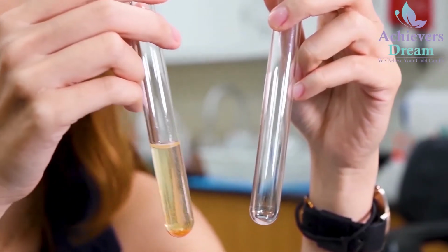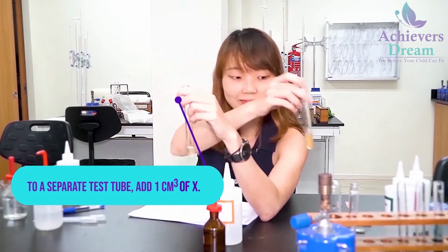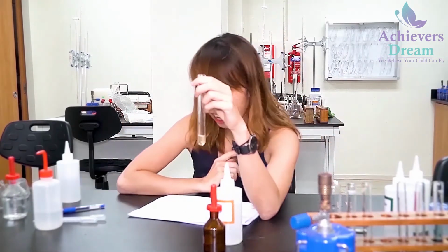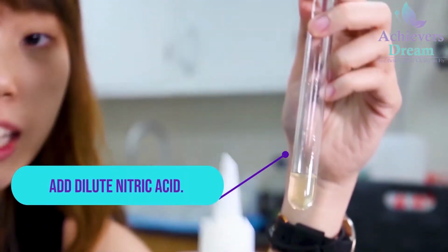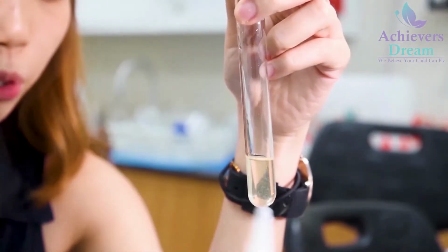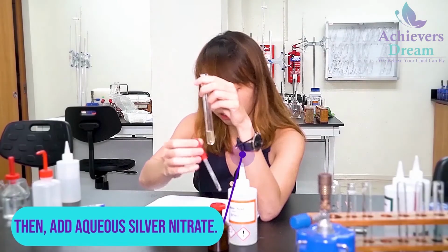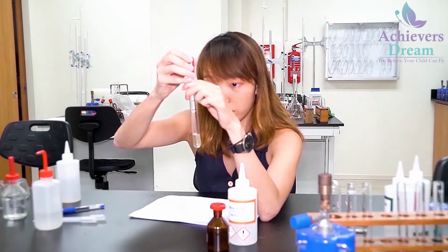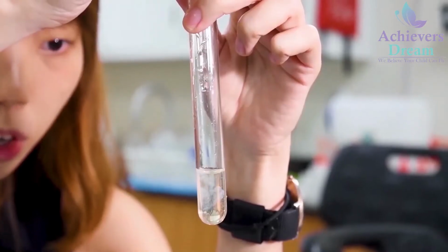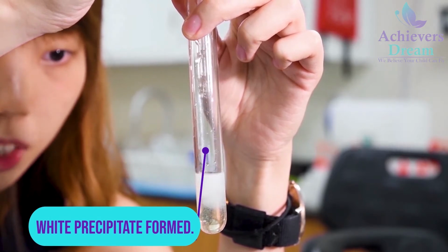Okay, so for part B, to 1 cm depth of X in another test tube, I'm going to add in dilute nitric acid, followed by silver nitrate solution. So upon addition of silver nitrate, there is production of a white precipitate.